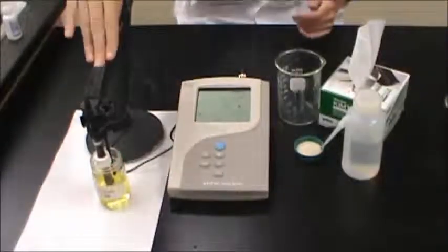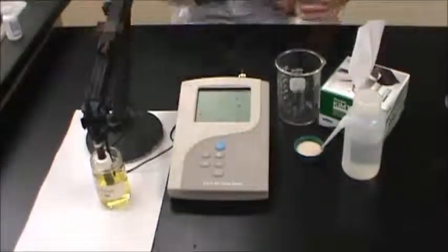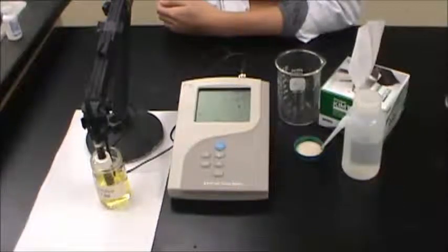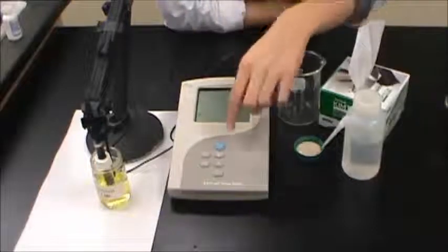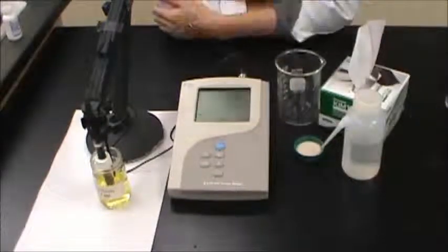Let the probe sit in the solution for approximately one minute before pressing the Read button. After a minute, press the Read button, and after a few seconds the pH meter should show the correct value for the standard.